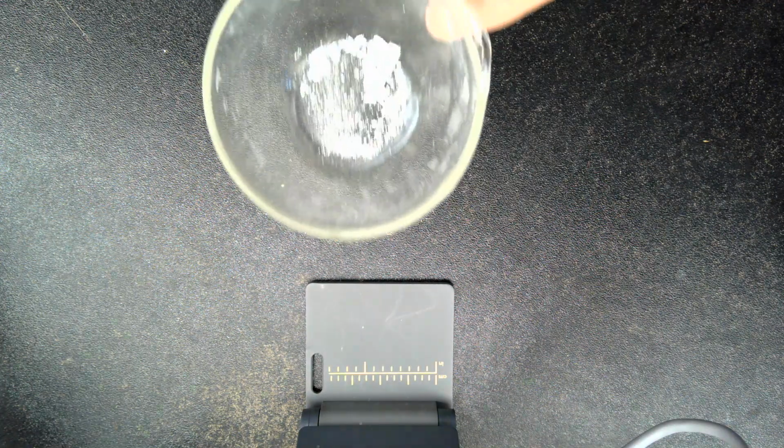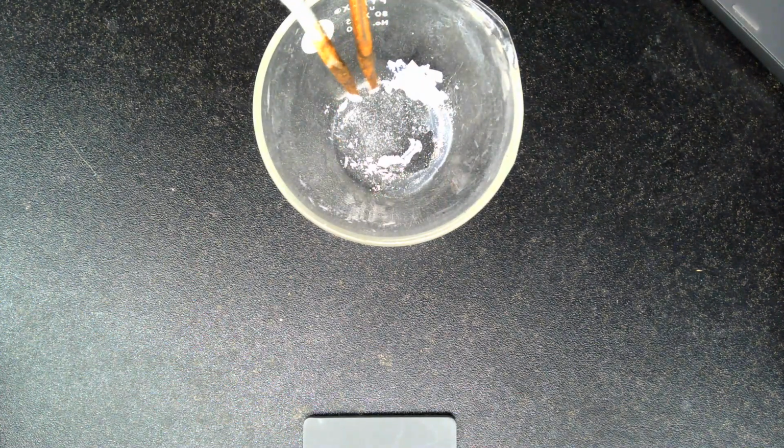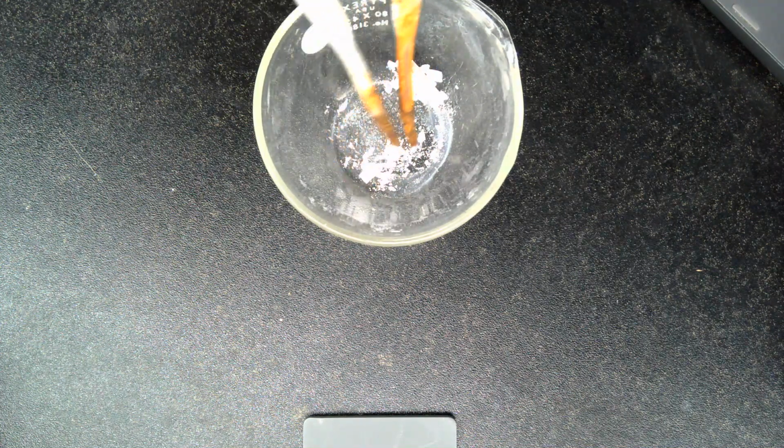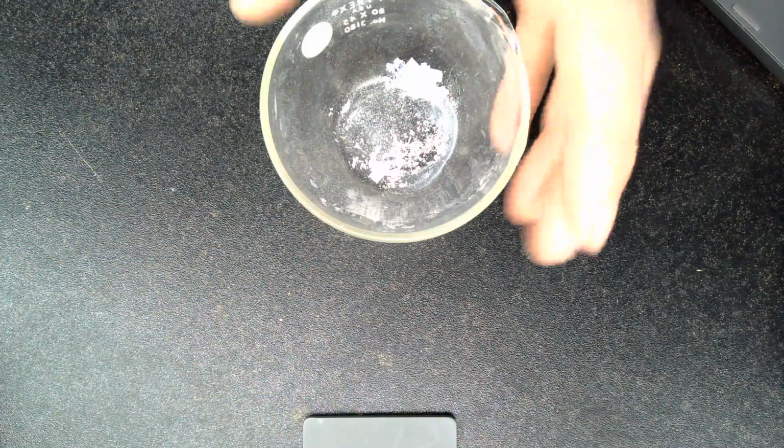Can't get it to focus. Turn it down here. It'll focus here. So you're left with this nice white ash. You want to take some observations on that. Here is our previous tray that has a bunch of the ash in it. You can see it's not very solid. It crumbles. It's kind of a grayish color. So there's the end of that reaction.